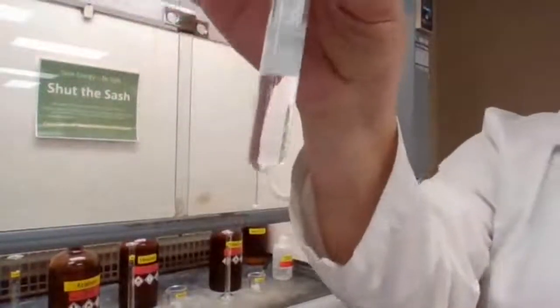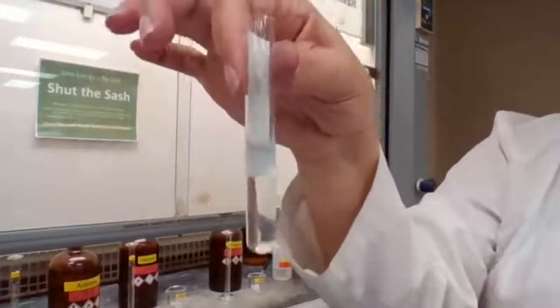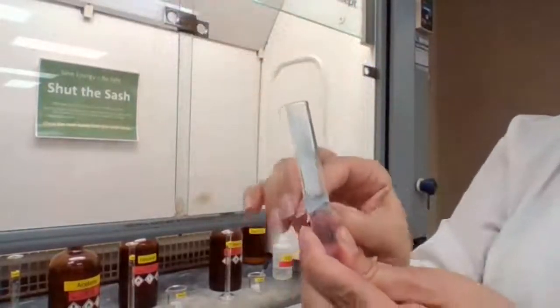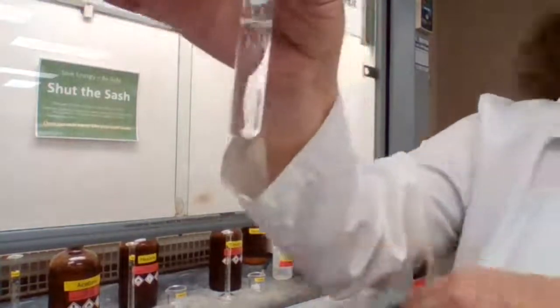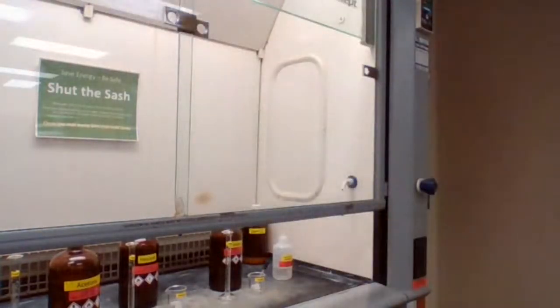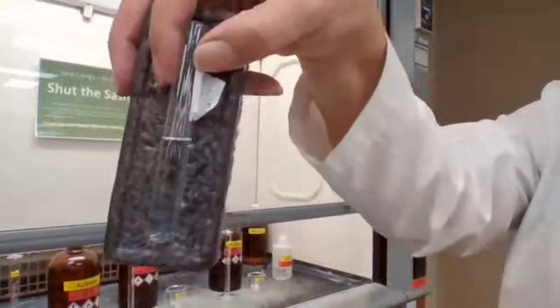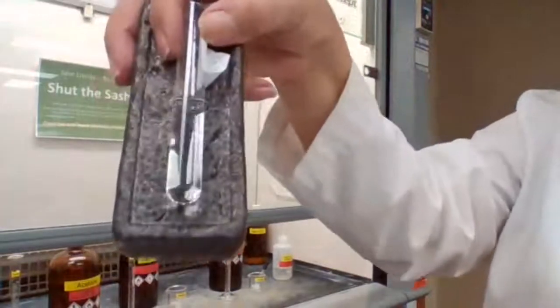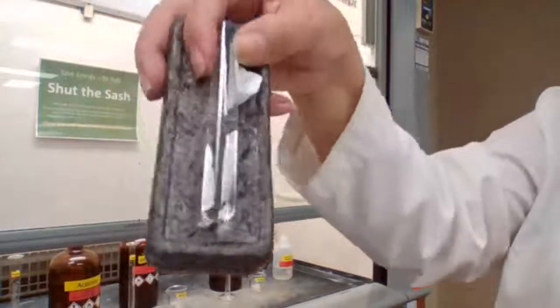So for you, you should see if this is 1 layer or 2 layers. This is water with acetone. Okay? 1 layer or 2 layers. And if it's 1 layer, it might be easier for you to see with the dark background. 1 layer means it is soluble. Do you see 2 layers, oil and vinegar like, or is it just all in 1 layer?